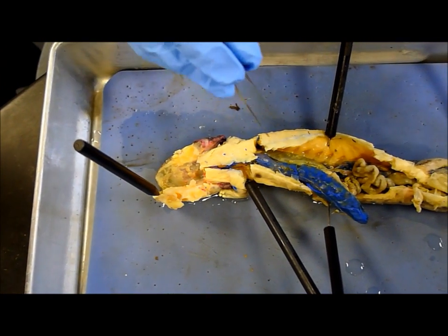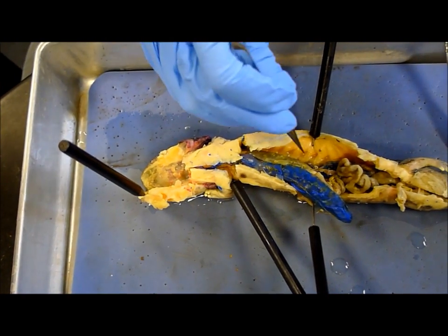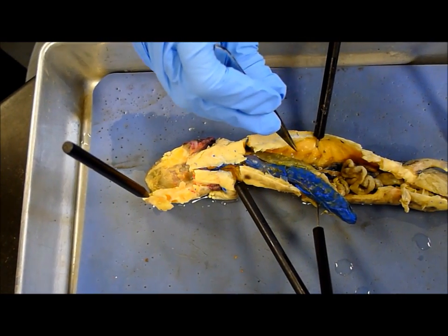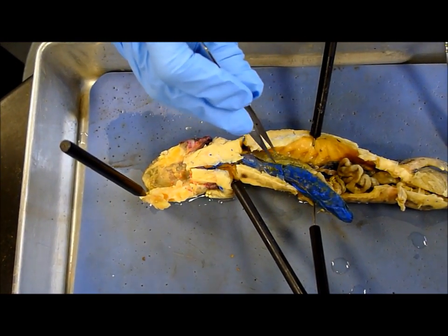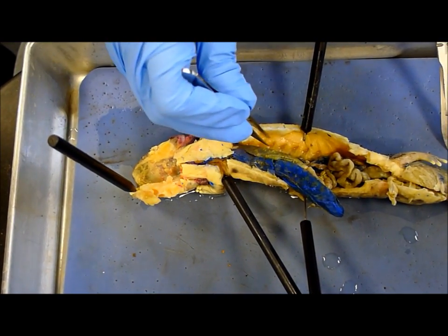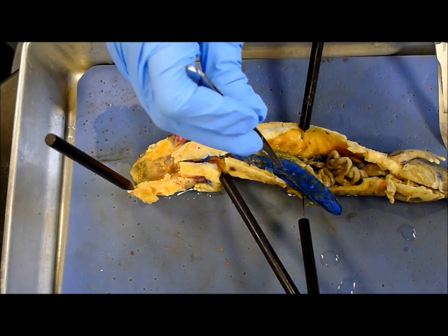Pleuroperitoneal cavity, which is just this. And the parietal serosa. Parietal and visceral serosa.